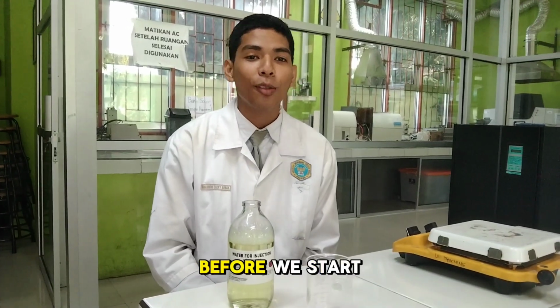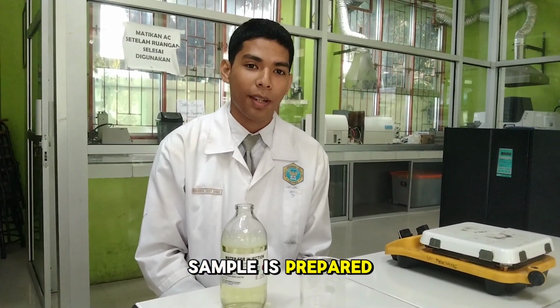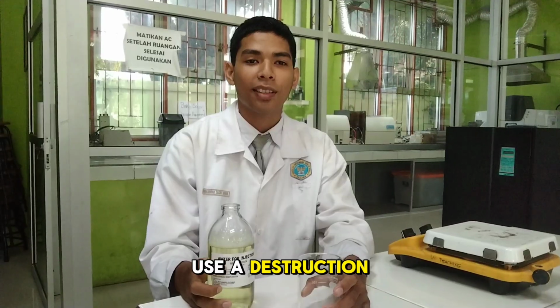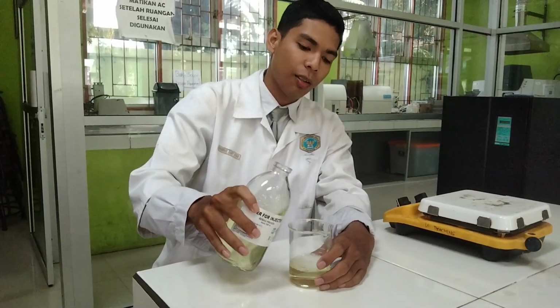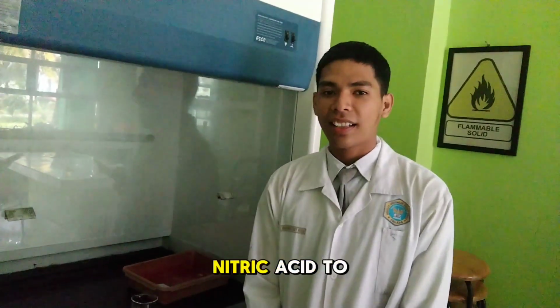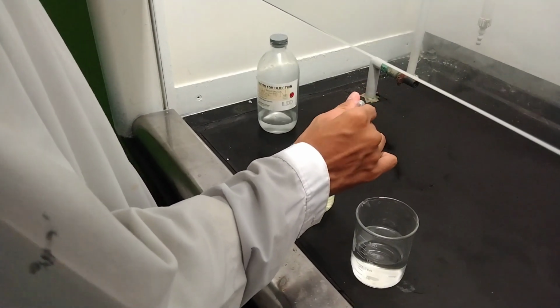Before we start the analysis, the first step is to prepare the sample. This is the sample we need to analyze, and I want to use the destruction method. We pour 100 milliliters of the sample into the beaker glass, and after that we add 3 drops of nitric acid to the sample in the 100 milliliter beaker glass.